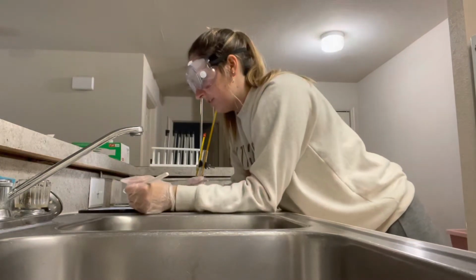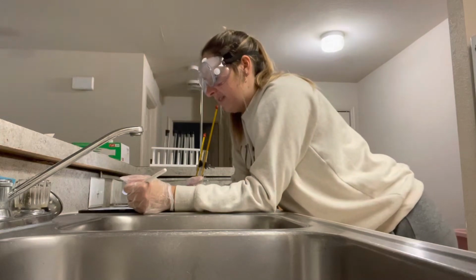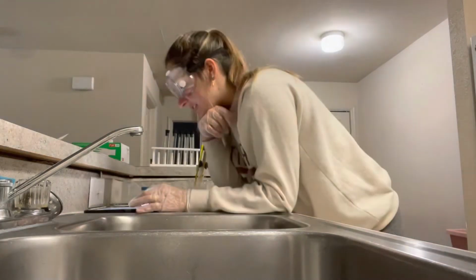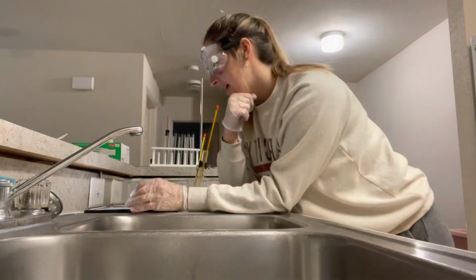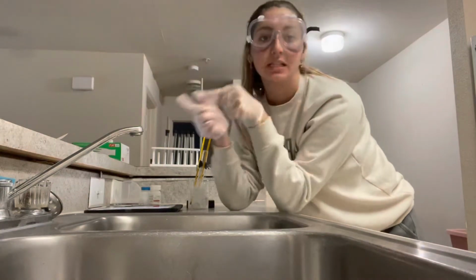It was 58 degrees Celsius, the solution, and then the ice was 15 down to 3 degrees. So 48 degrees Celsius should be the freezing point. All right, so now I'll remelt the solvent to use in part C, and the solvent must remain completely melted to perform part C. So on to the melting.